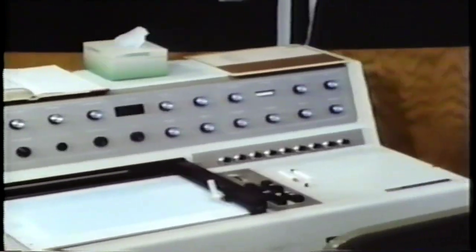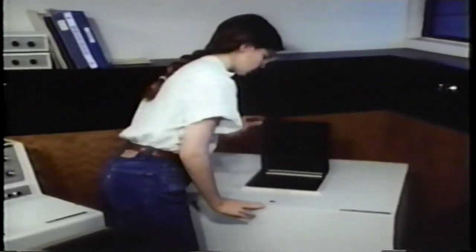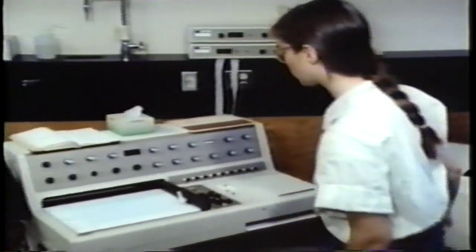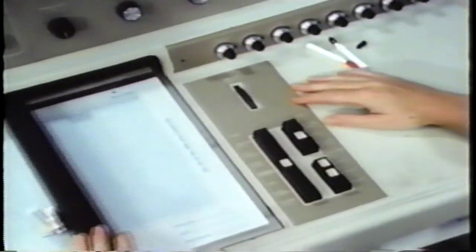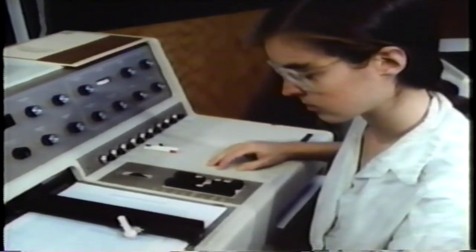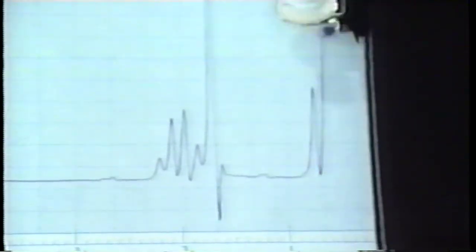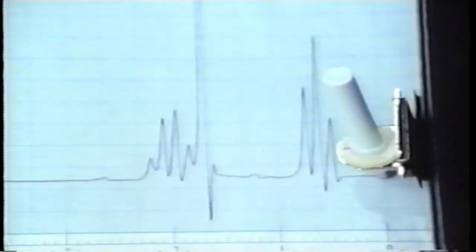Nuclear magnetic resonance spectroscopy, called NMR, is another way to identify a compound. The newly synthesized material is placed in a magnetic field. NMR is especially useful when a previous sample of the product is not available for direct comparison. Often, using NMR, only the empirical formula may be needed to deduce the full structure. This type of spectroscopy measures the absorption of radio waves by nuclear magnets placed in a strong magnetic field. Protons, like the ones in the 2-butanone, are nuclear magnets, and the energies they absorb are characteristic of their chemical environment.